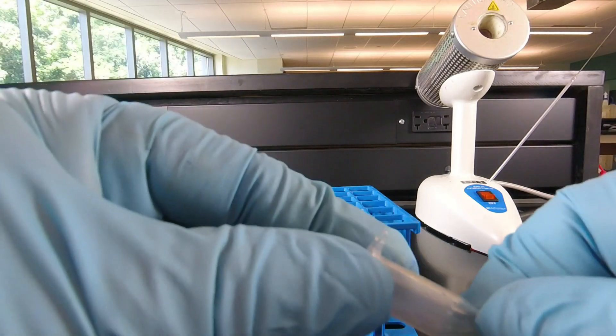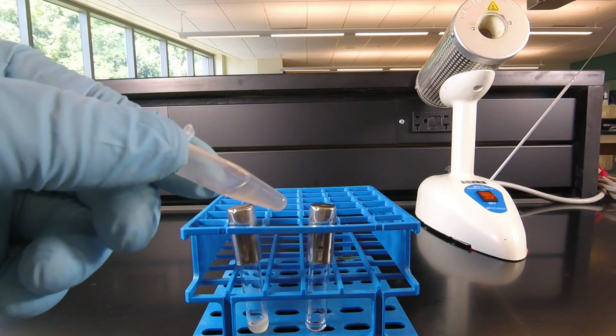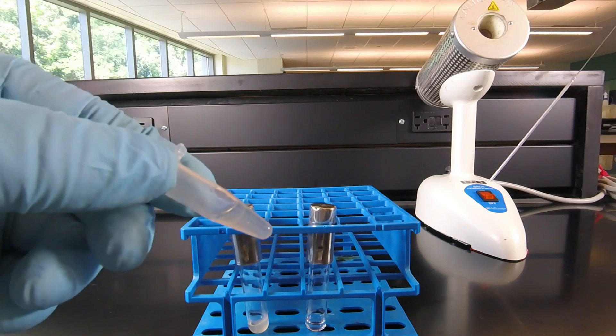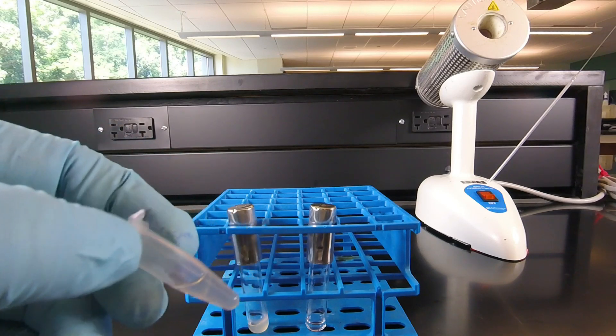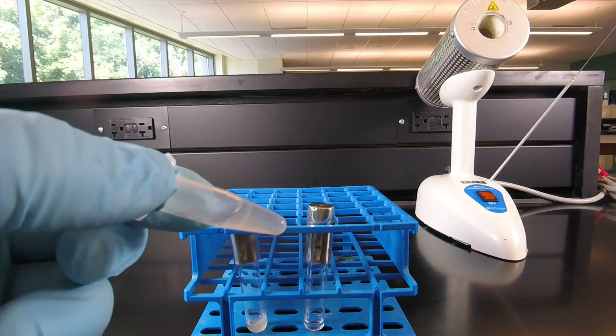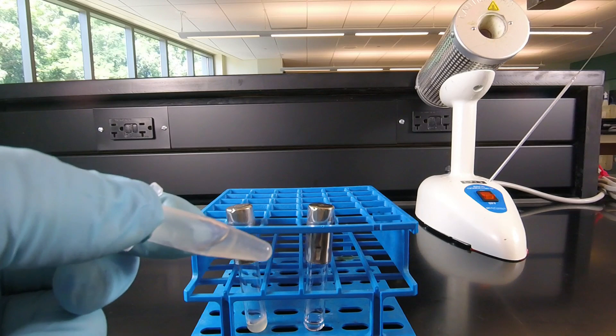In lab we're going to be doing this using small centrifuge test tubes, but these are a little harder to see the results on when I try to video it, so I've showed you the results in a tube rather than in the small tubes that we'll be using in lab.